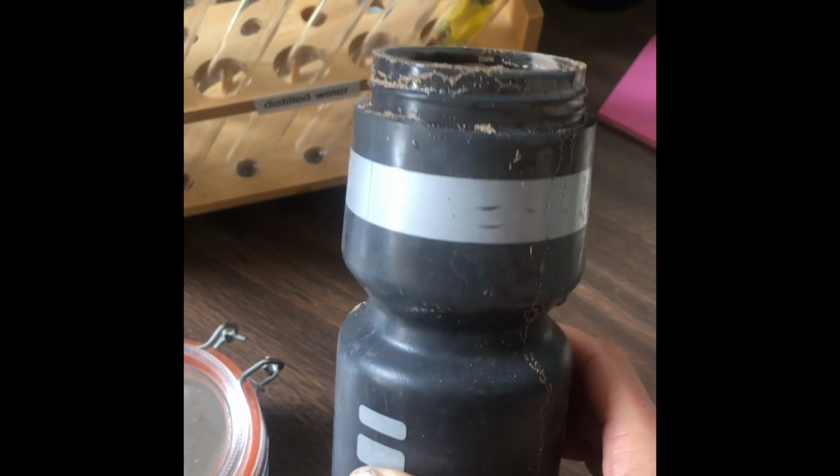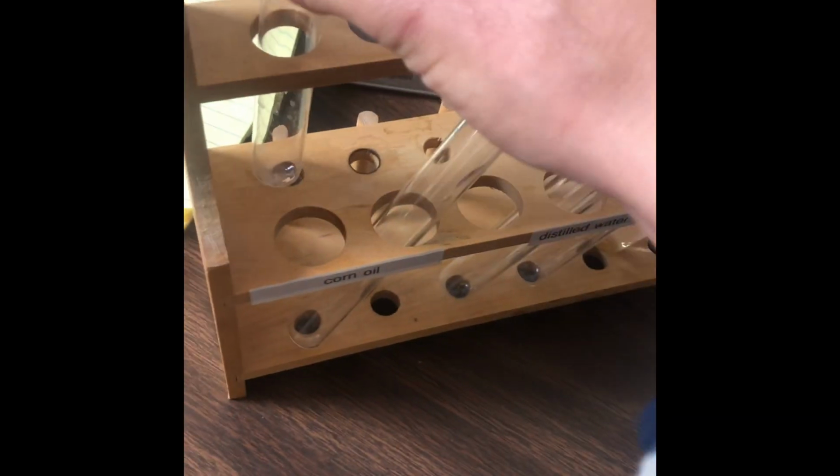All right, hello. We have here a little experiment. So this is from the Great Salt Lake from yesterday when I went out. I am going to, smells really good. I'm gonna pour some of it in here. I'll take a closer look. Yummy. So this was just skimmed right off the top there of the water.